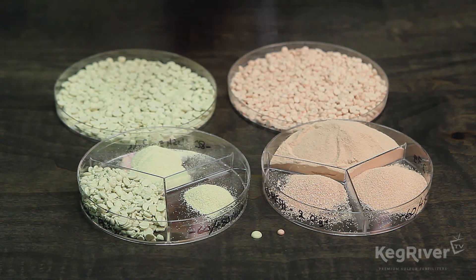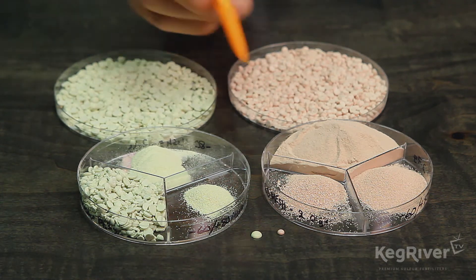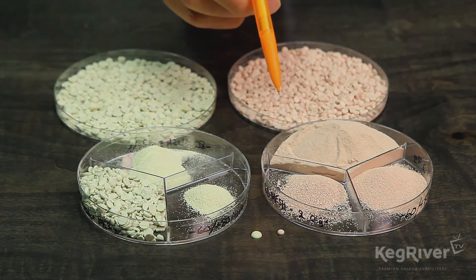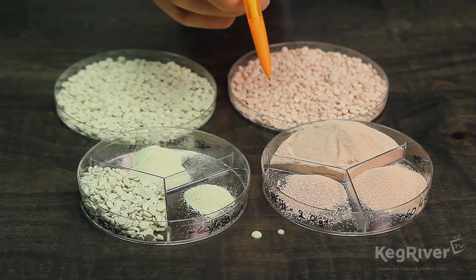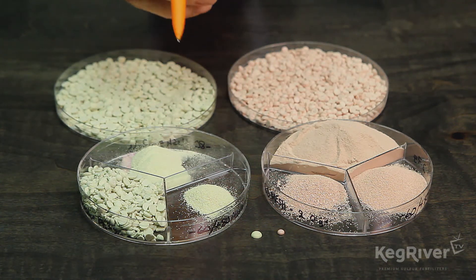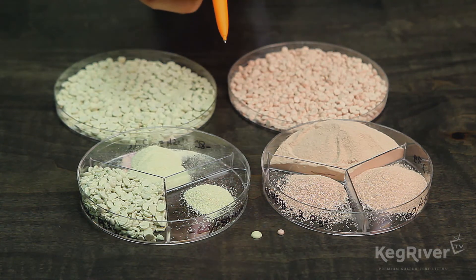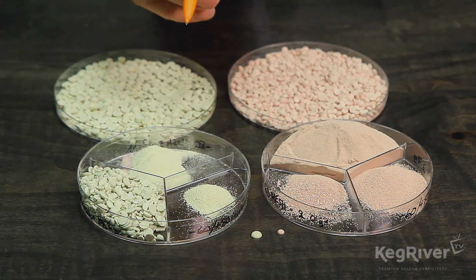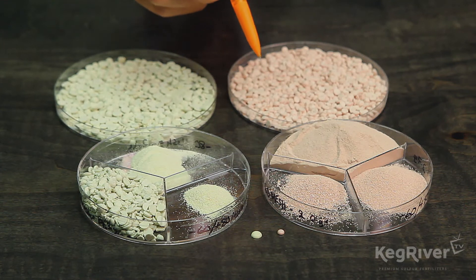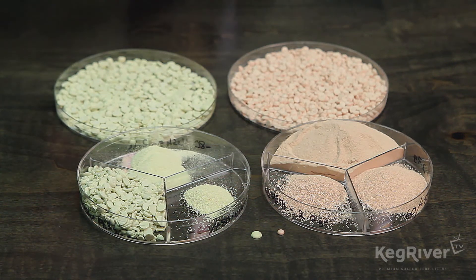After going through the screens, this is what you see. In the back part of each tray, you have the particles which pass 80 mesh, representing a particle size of about 180 microns or less. This represents a size which is easily oxidized by thiobacillus into plant-available sulfate.